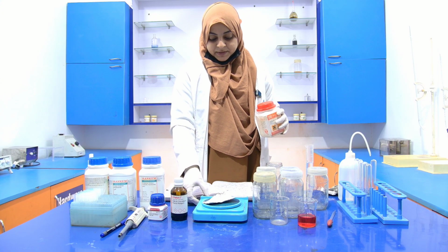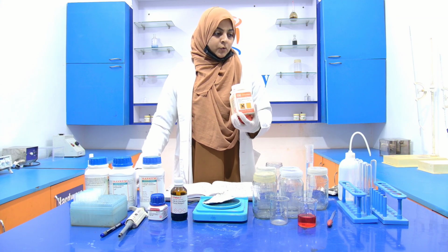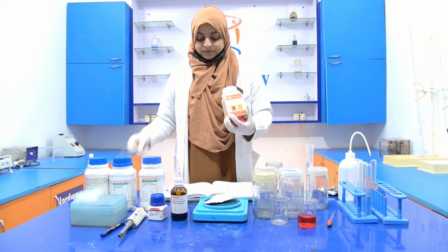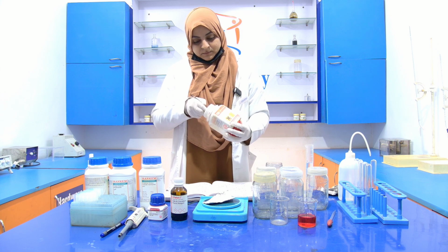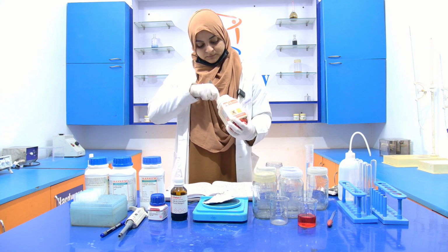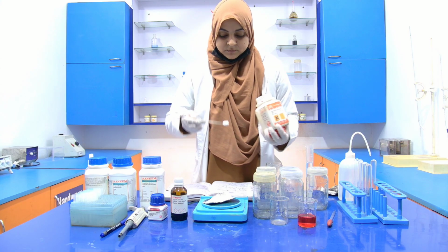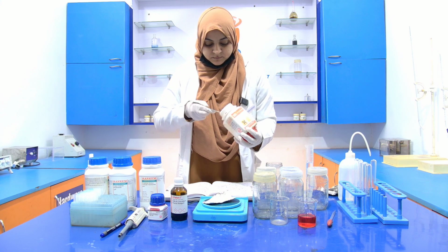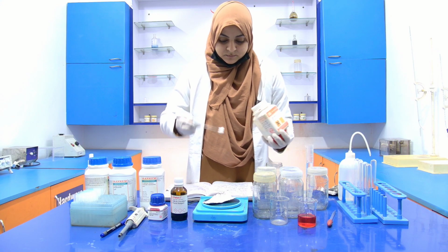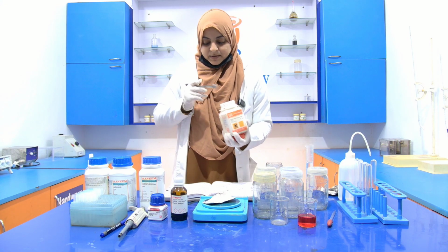Again, you have to tare it. Now, measure 2 gram.